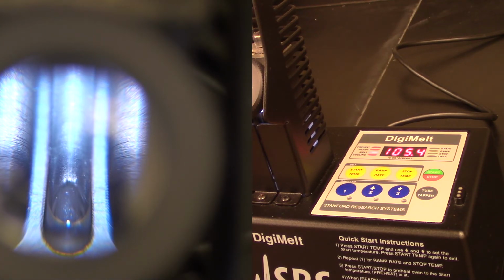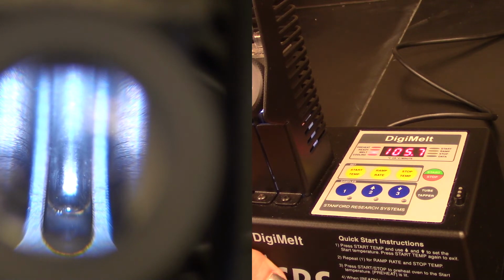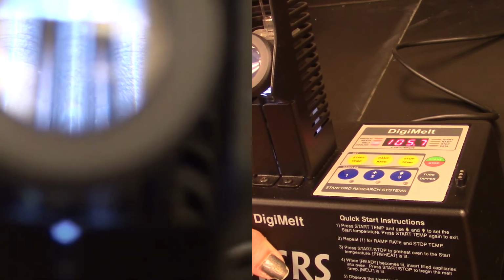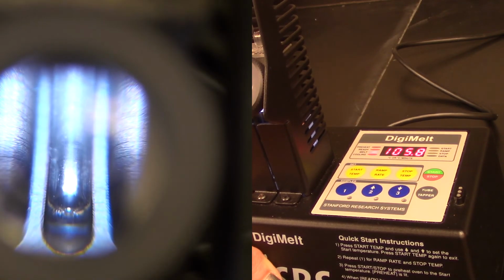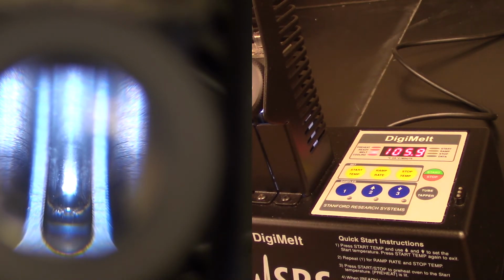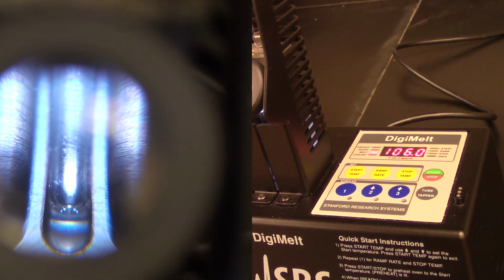So now we're going to keep an eye, and when the last little bit of that has melted, we are going to say that is the end of our melting point range. And that looks like right there, so we're going to record 105.7 degrees as the final melting point. One thing that you may want to do is kind of raise your tube up a little bit as you're looking at it. You can get a slightly better view of it when you're looking at it in person that way. And so it's as simple as that.